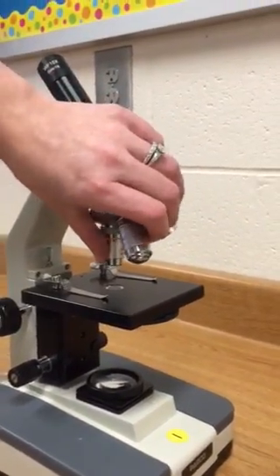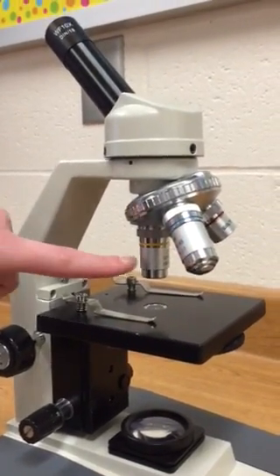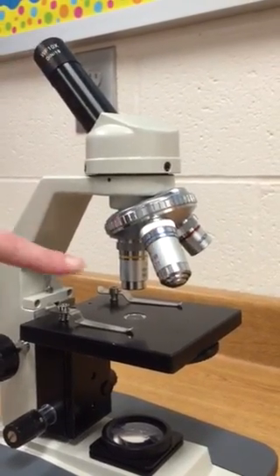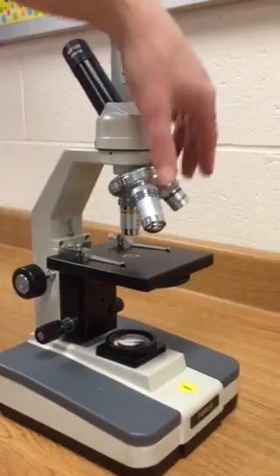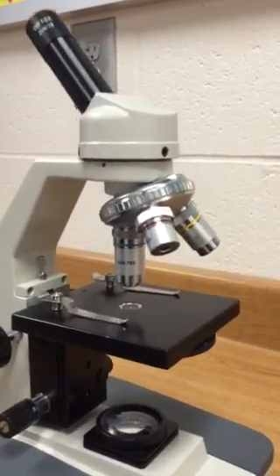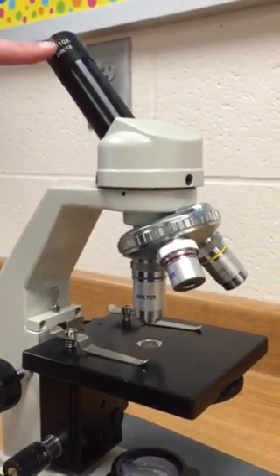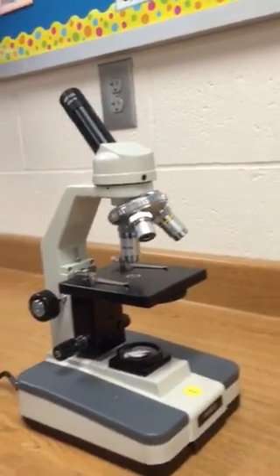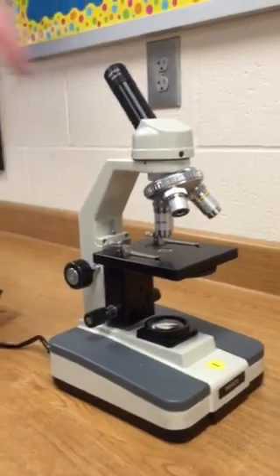The same goes for the medium objective — because that objective is ten times, and the eyepiece lens is ten times, ten times ten means I'm looking at my object one hundred times. Then if I switch to high power, that's forty times magnification, and my eyepiece is again ten times. So really, when I look at something on high power it is magnifying my object four hundred times. Pretty amazing.